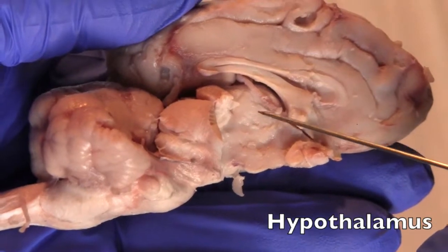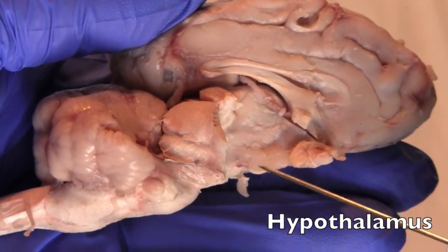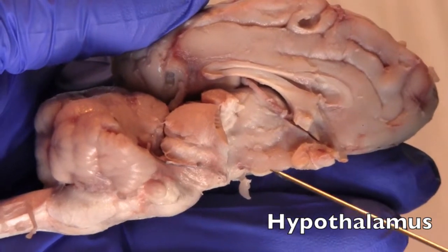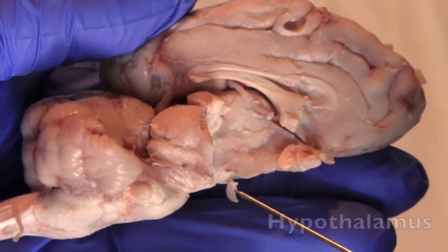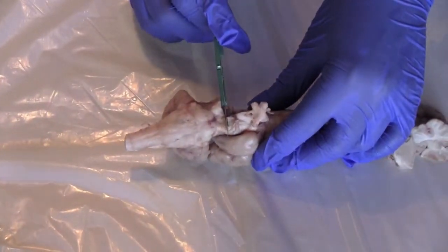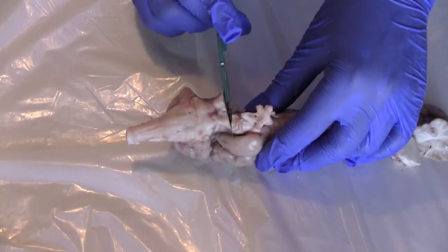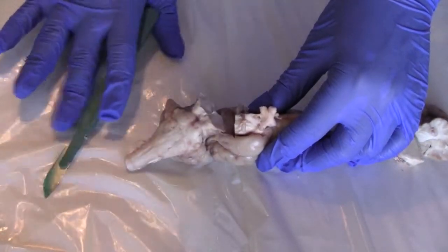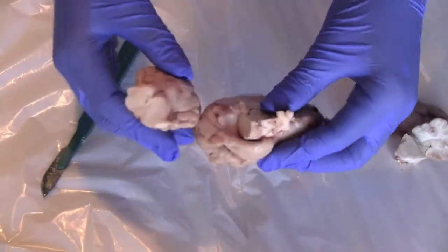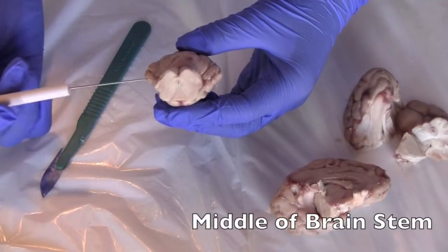So right here is the thalamus, and the hypothalamus lies right under the thalamus, and the function of the hypothalamus is that it deals with biological drives like sleep and hunger. Now we're going to finish this cut right here so we can cut off the brainstem. We're looking at right here is a cut through the midbrain of the brainstem.